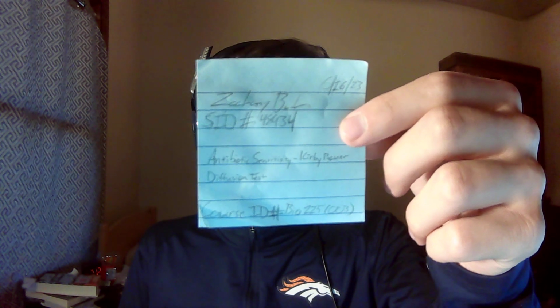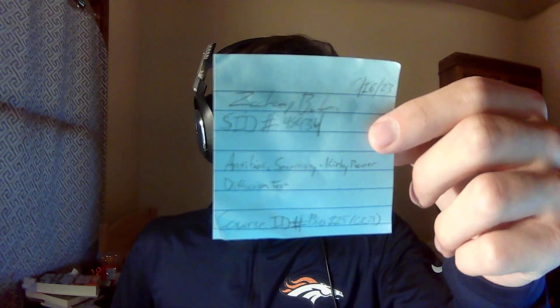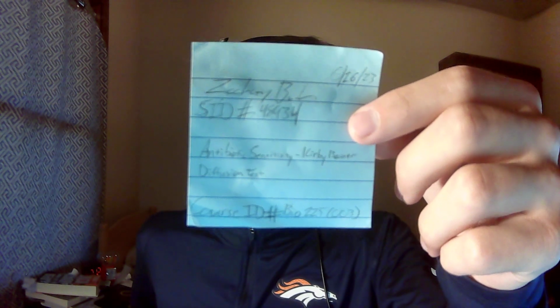Here's my student ID, course ID, and the name of the experiment I'm doing. I'm doing the antibiotic sensitivity Kirby-Bauer diffusion test. And here are my results.